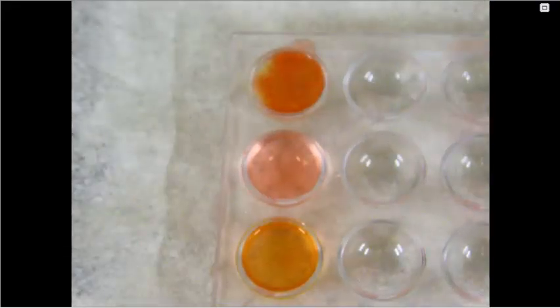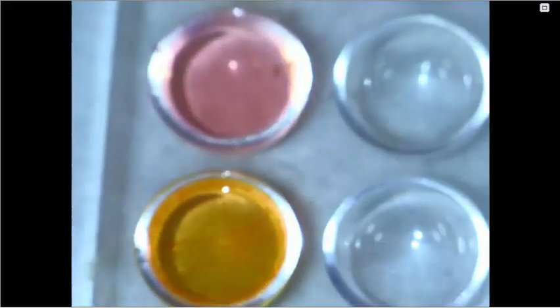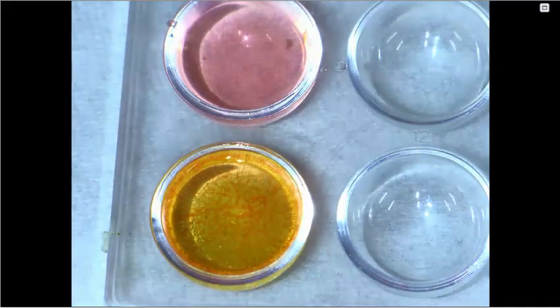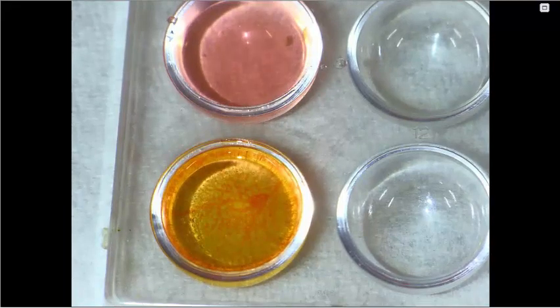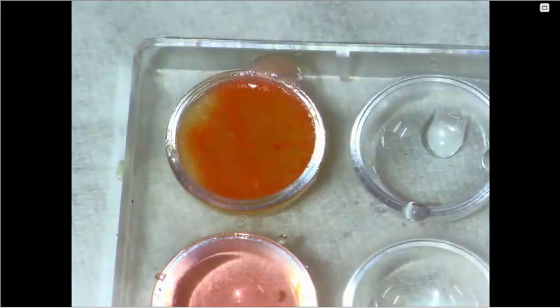If you look carefully, see if that light helps at all. You can see some little clumps in the well that has the vegetable oil in it. So you can see some of that orange clumping in there. In the middle one, that's with the distilled water, there is no clumping. If we look carefully at the McMush solution, you can see a little bit of orange clumps forming in the lipid test. Because we see orange clumps forming, that means that this is a positive result.